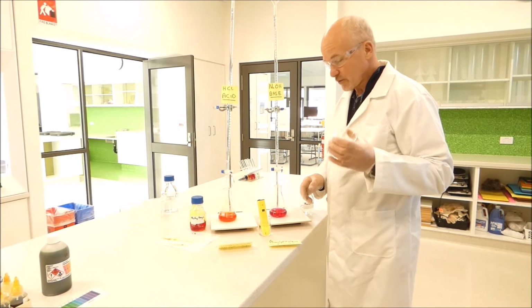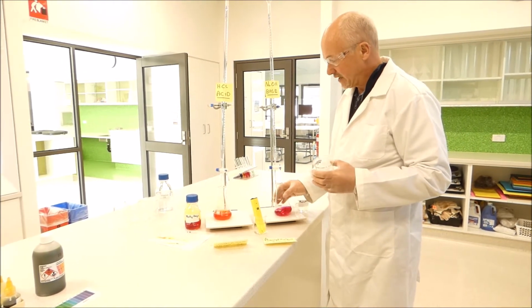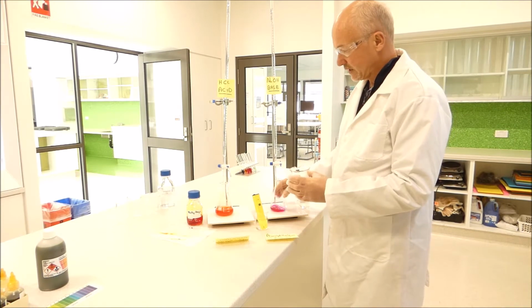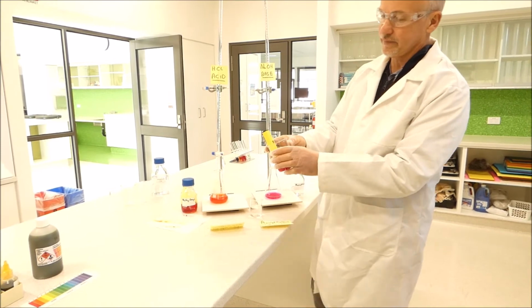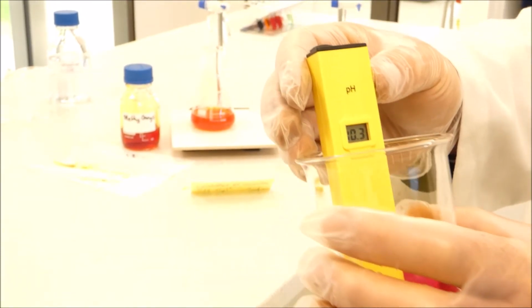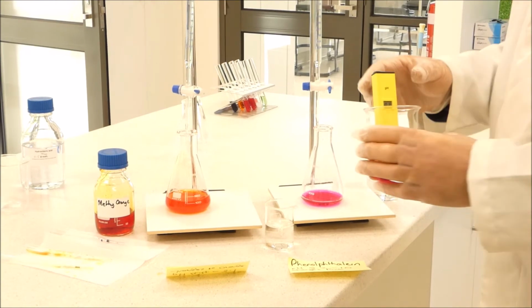Alright, so what we're going to do now is test the pH using an electronic pH meter, which is reading at about 8 for distilled water at the moment. We're going to put the solution we've just tested with phenolphthalein into a beaker, put the pH meter in and see what it reads. I don't know if you can see that or not. It's reading a pH of about 10.2. Now phenolphthalein changes to a full pink colour at 10, so that's showing it's quite accurate. It's changed at the pH that we were expecting.